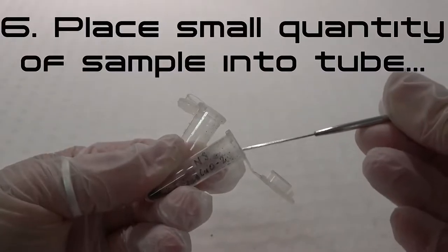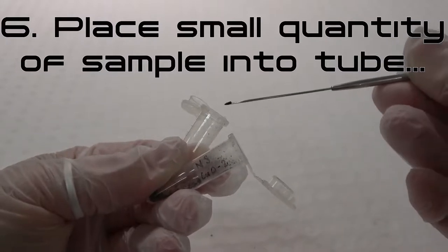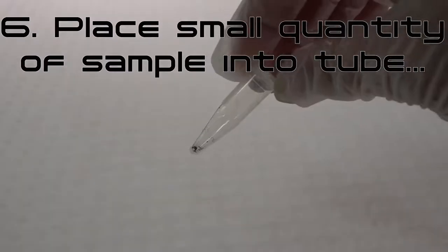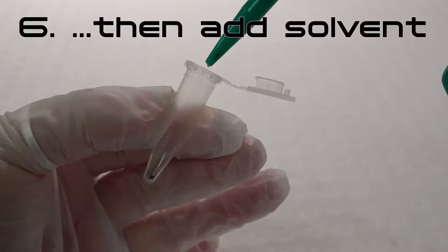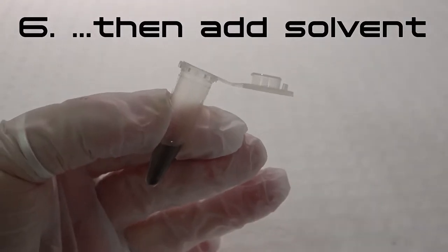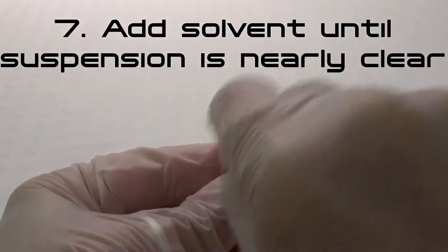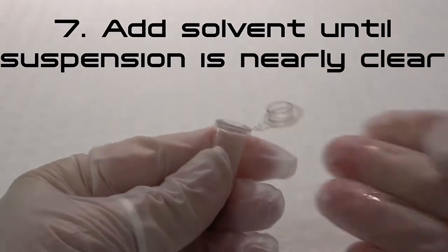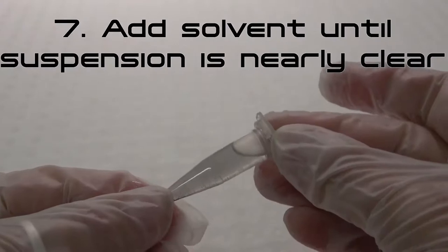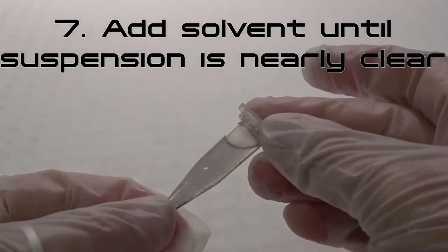Step 6: For dry particles not already in suspension, place a very small quantity of your sample into the microcentrifuge tube using a small, clean spatula, then add a few drops of your chosen solvent. Step 7: For all samples, check that your suspension is only slightly cloudy. If necessary, continue to add solvent until the suspension is nearly clear.